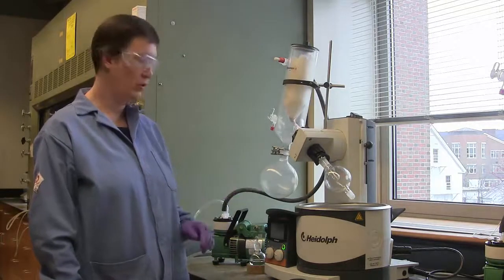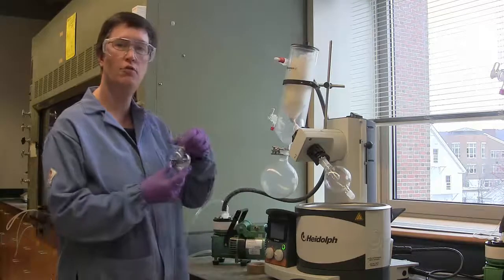This is a rotary evaporator. We use it to evaporate solvents from reactions.